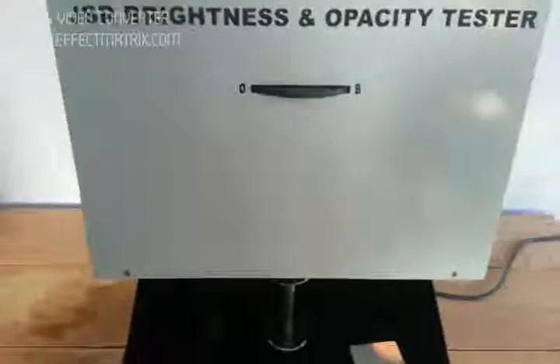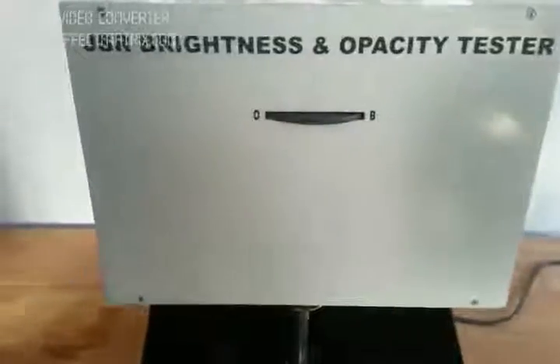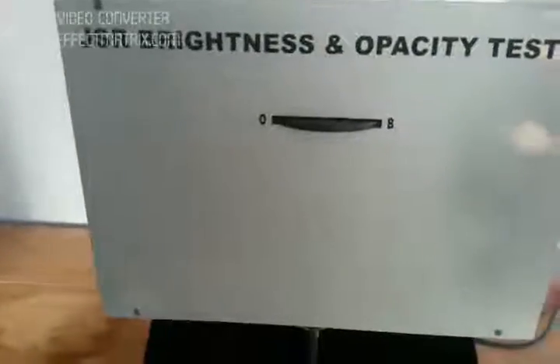The upper view has the filter selection option, where 'O' indicates opacity and 'B' indicates brightness. This is the back panel where both sensor outputs go into the electronic circuit, and this is the main power circuit.